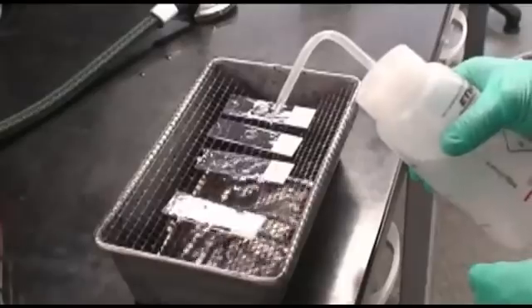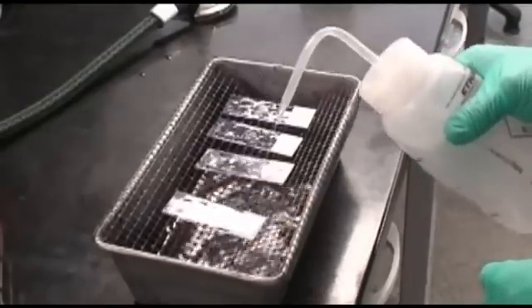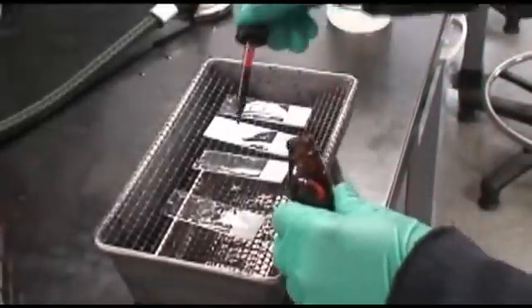The exact time of this flooding depends on when the color dripping off the slide is no longer purple. When this occurs, stop decolorizing.